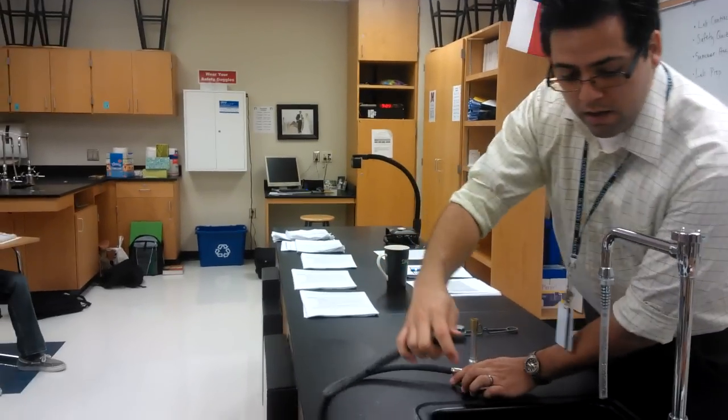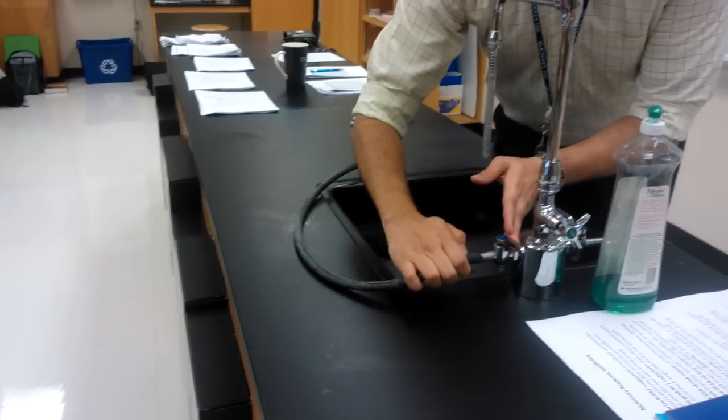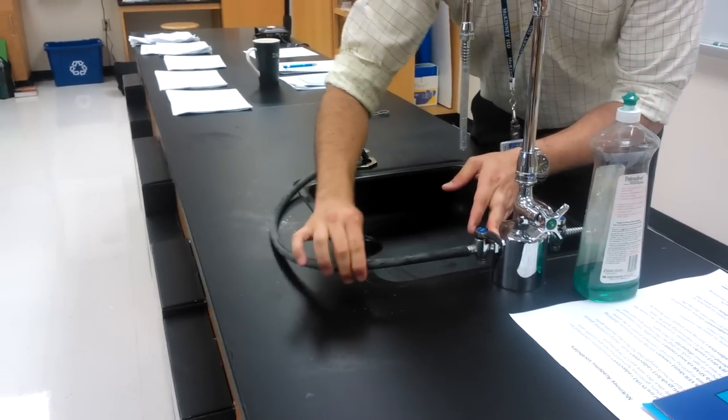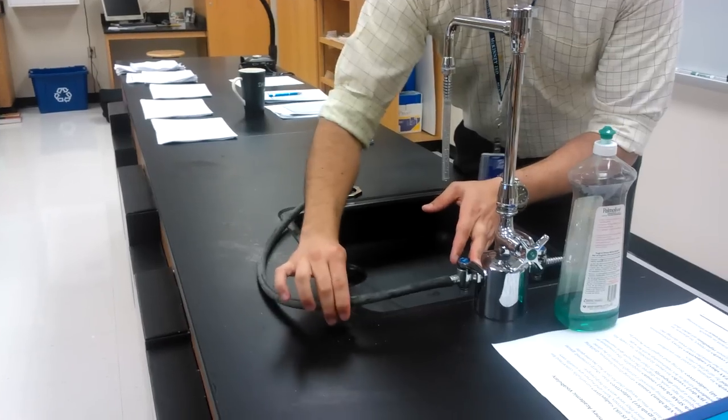So I'll take the hose and push it into the nozzle just until I can pull on it gently and it doesn't come off. I'm pulling on it gently and it doesn't come off.